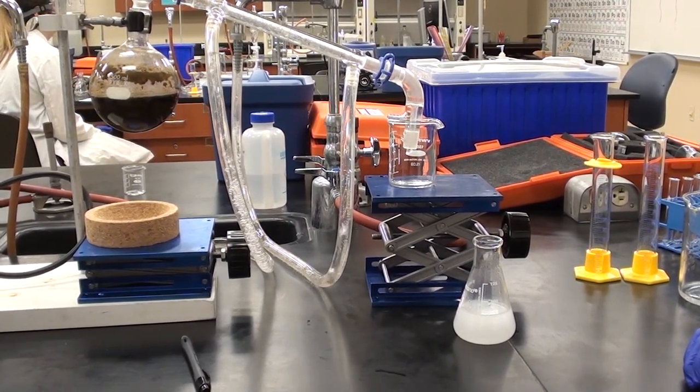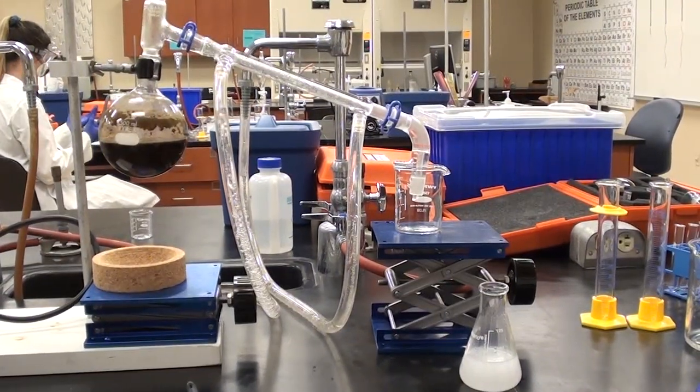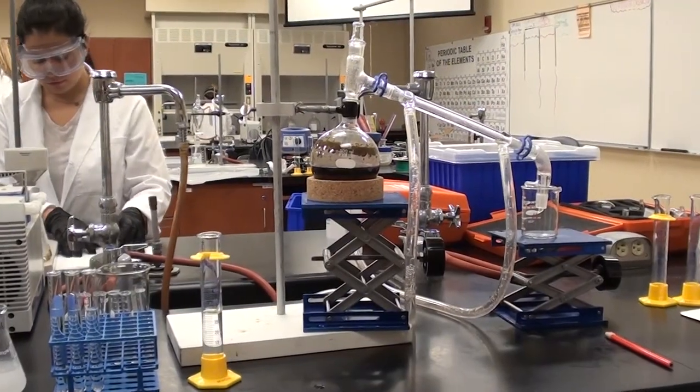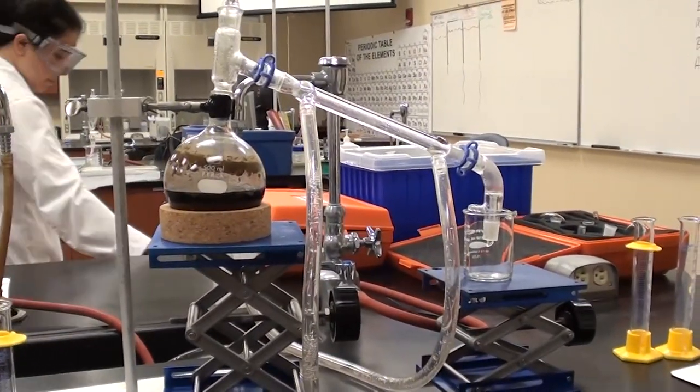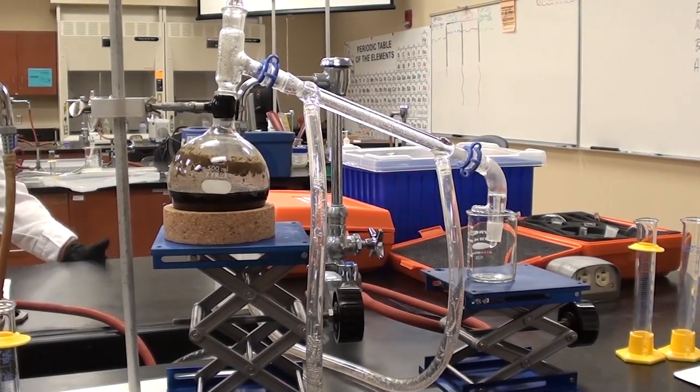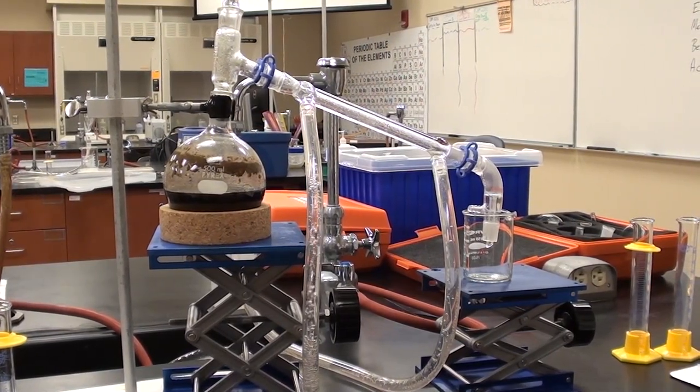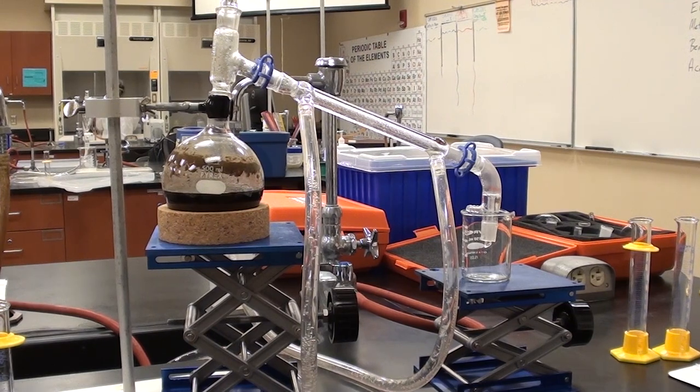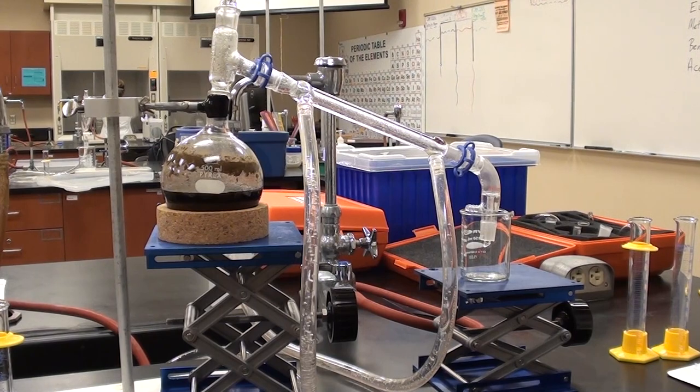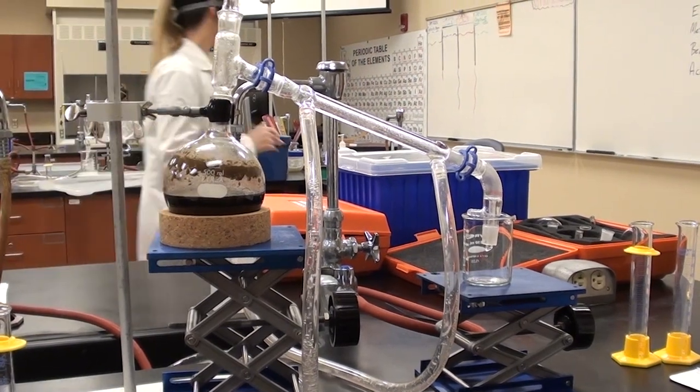Now while that's cooling, and it's going to take a while to cool, we can be working with the extractions. To cool this down, I think it's a good idea to do what Jan's done here and put it in a cork ring and just let it sit while it cools. It will be cool by the time you get done with your extractions, but this should be the last thing you do is to clean this up and take it apart.